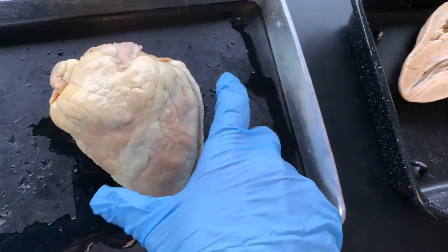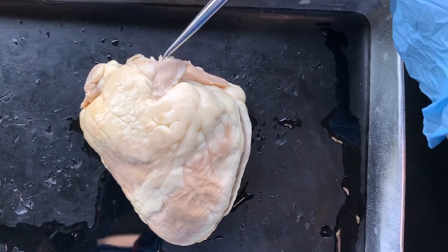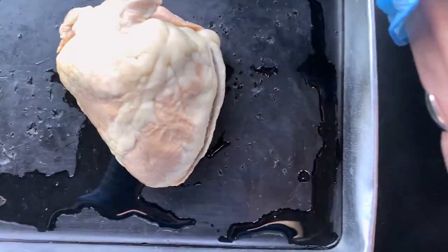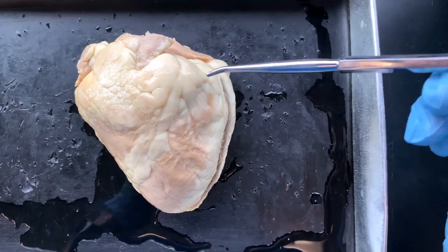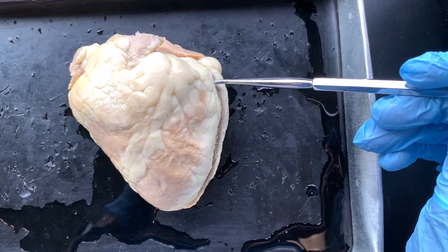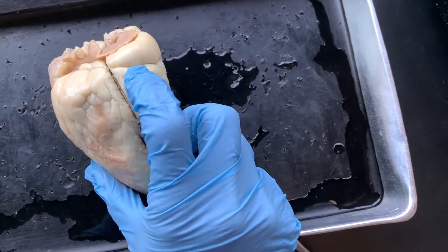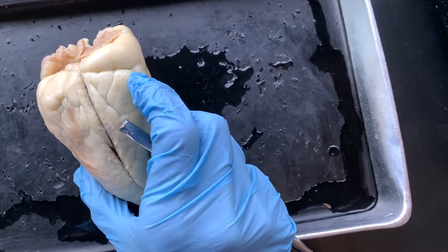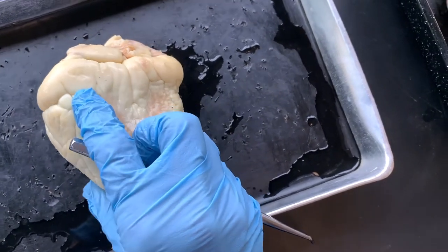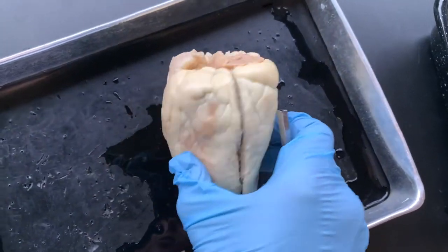Let me reorient this for you. Let's find the nose on the heart — or the pulmonary trunk. You know it's not called the nose, it's just a reference. So, pulmonary trunk. If we were to go to the left side of the heart — this side, the side that carries oxygen — and trace this sulcus around the side, you will see that there's a line here. This is that horizontal line, the atrioventricular sulcus. And underneath it, you would find the coronary sinus going all the way back to the right atrium to return the deoxygenated blood.